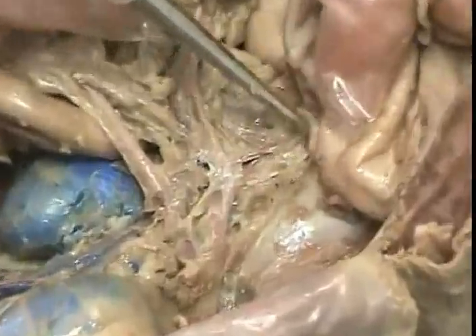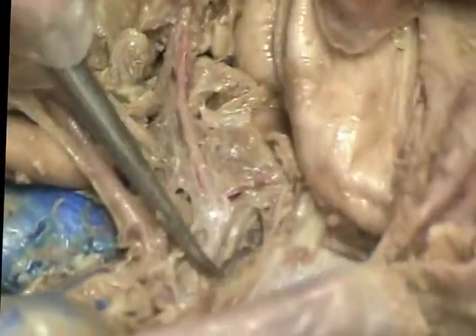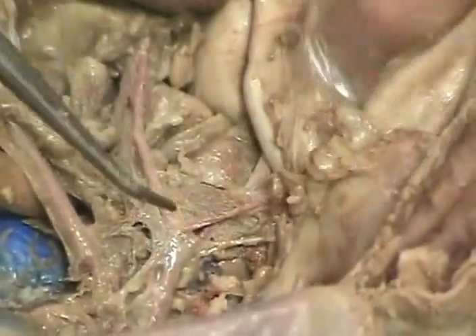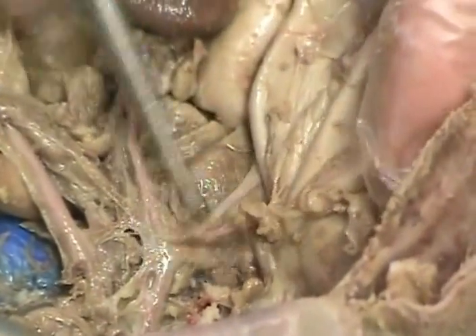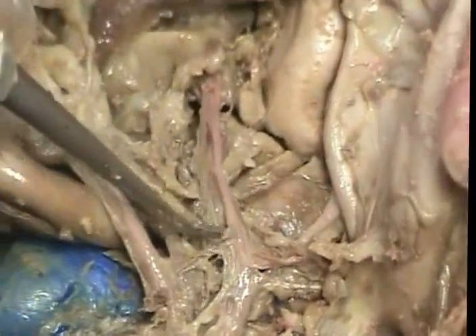The first one branches up underneath to the liver, called the hepatic. The next one branches, oh, I'm missing one. Did I miss this one before? There it is. Hepatic goes to the liver. The second one goes to the stomach. That's the gastric. Oh, yours is twisted. This one's hepatic, this one's gastric, and this one is splenic.